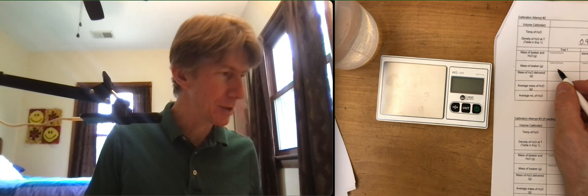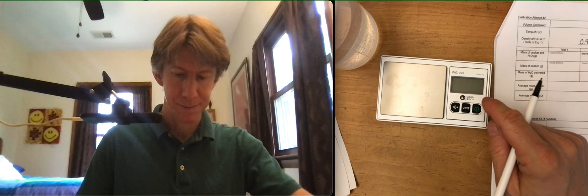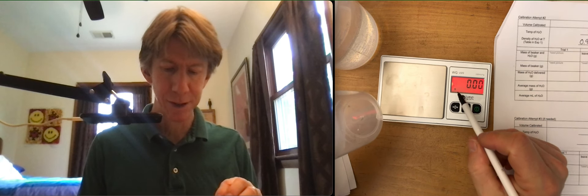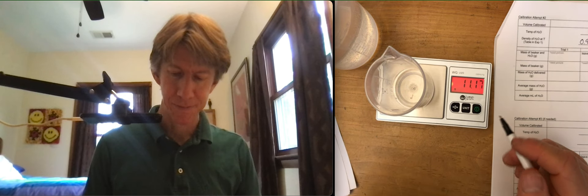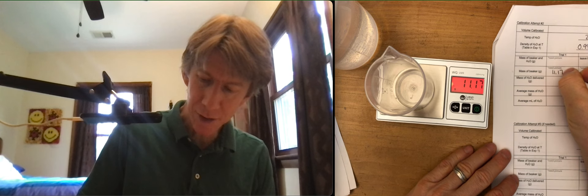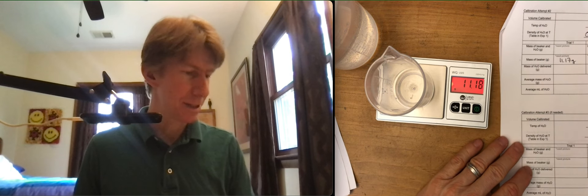Let it turn on. Wait for the dot to appear. There may be a little bit of water in it this time, so it's a little heavier. You could dry yours off if you'd prefer, but I don't need to.